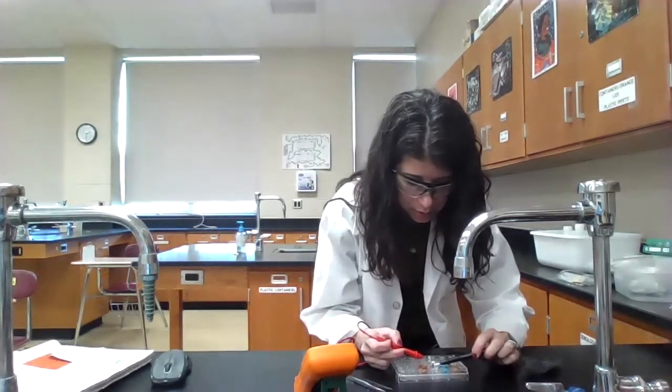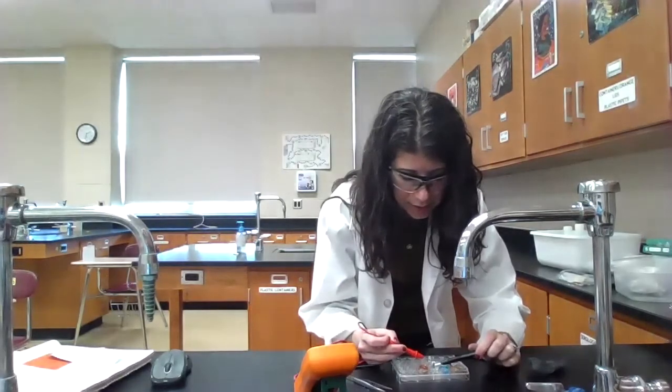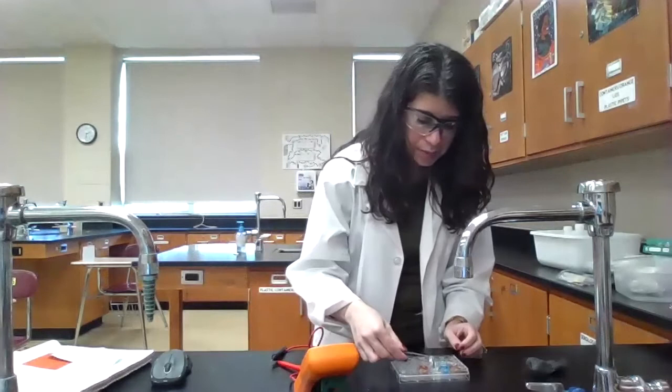So I'm going to make the magnesium the anode. Again, that's the black. Let's see here. There we go. All right. So I'm getting a reading of 2.04, slightly above 2. But again, that's why we do want to change the sensitivity there. So magnesium and silver, they're pretty far apart from each other on our reduction table. So we do expect a pretty large difference in their potential values.